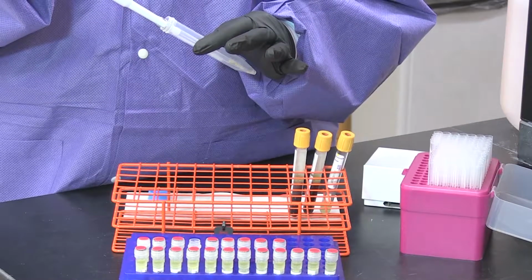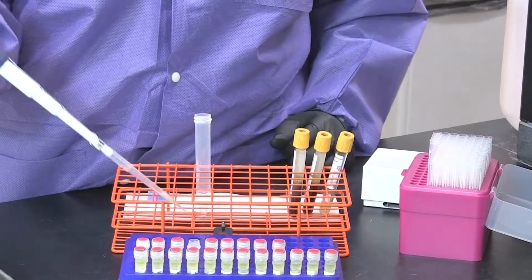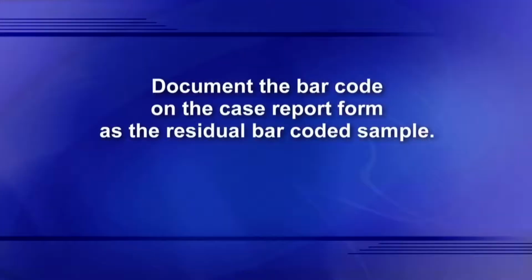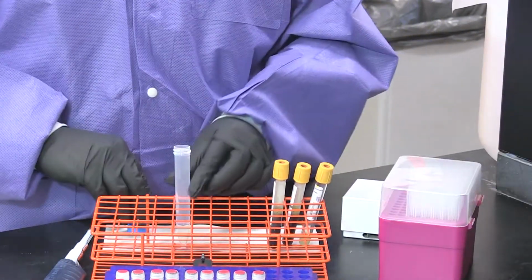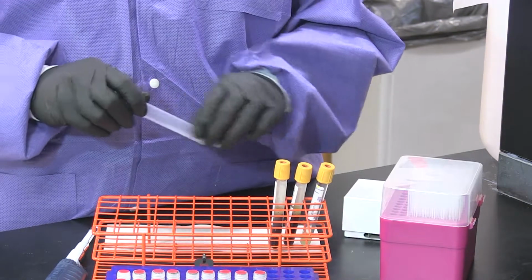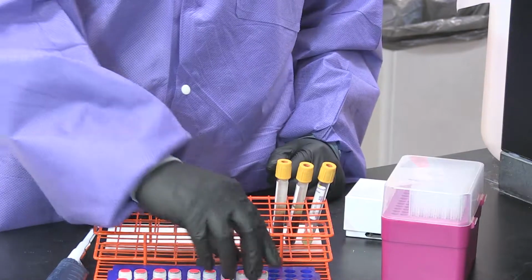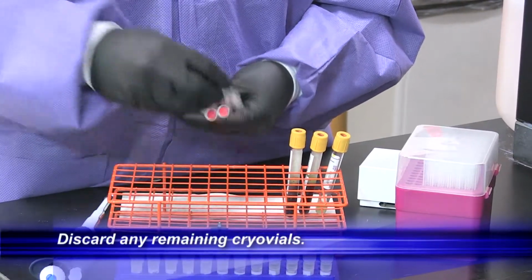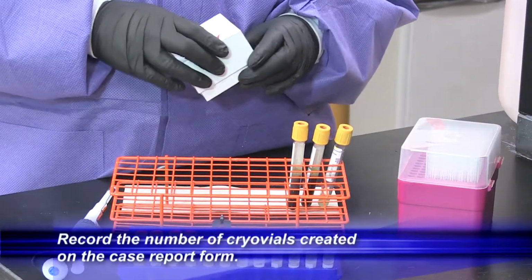At the end, take the residual supernatant and place into the final cryo vial, making sure that you record on the case report form the barcode of that residual sample. You're going to dispose of that 15 ml conical tube into the appropriate biohazard bin and discard any remaining empty cryo vials. Record the number of cryo vials created on the case report form.